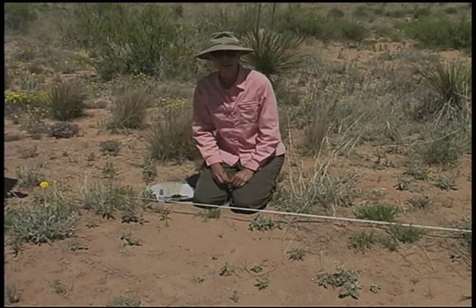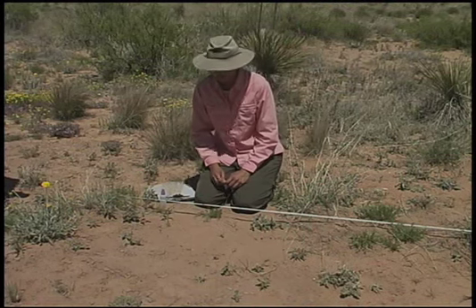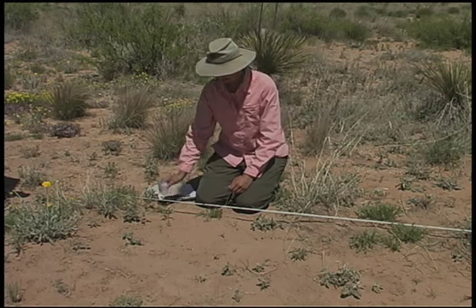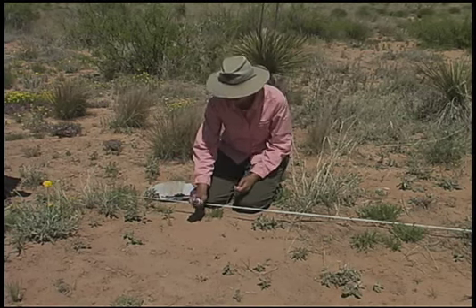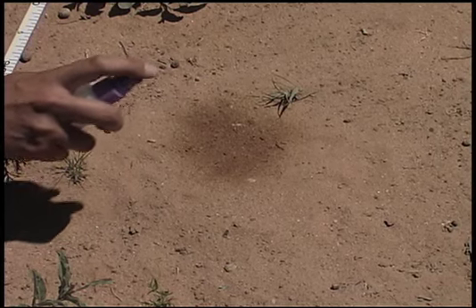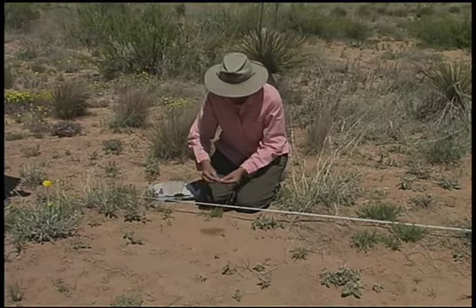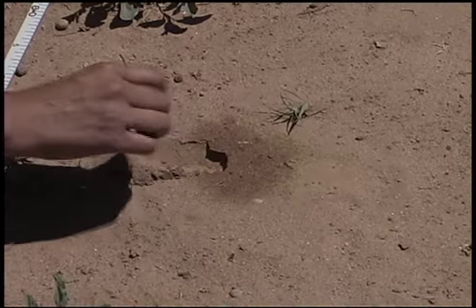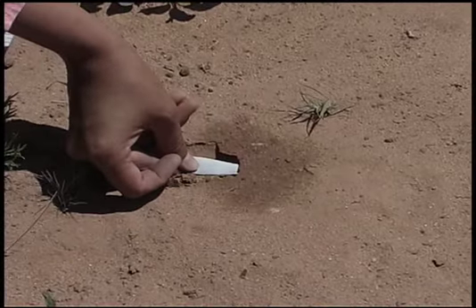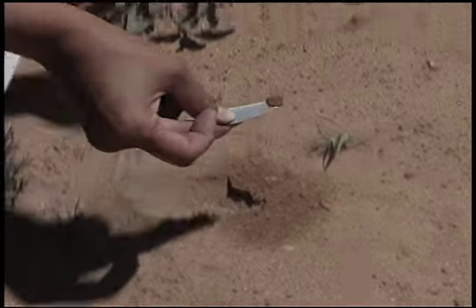If the soil surface is unconsolidated, has loose grains, or will not hold together with a soil crust, it is necessary to spray deionized water onto the surface. Depending on your bottle, spray 5 to 6 times. You don't want to saturate the surface, but get that 2 to 3 millimeters wet, and then take your sample. If your sampling point falls on a rock that is greater than 5 millimeters in diameter, record an R on the data sheet and move to the next sampling point on the line.